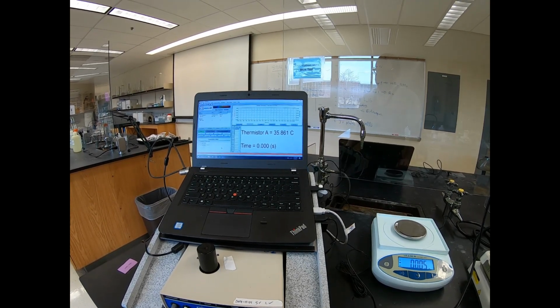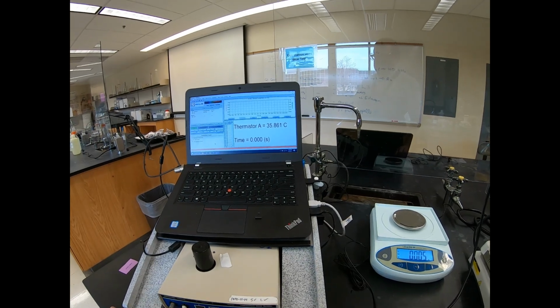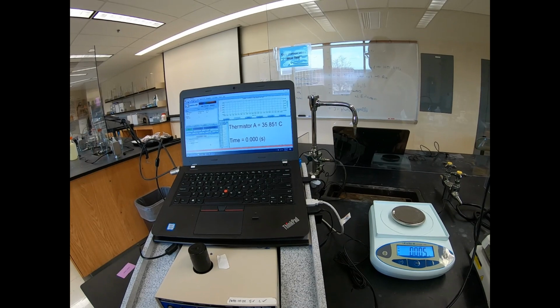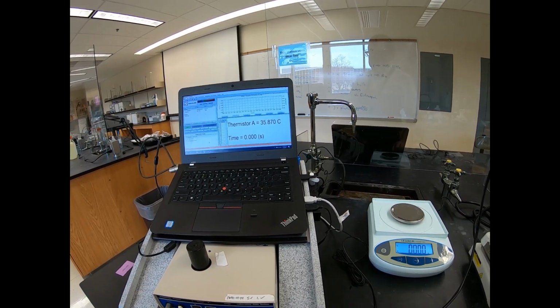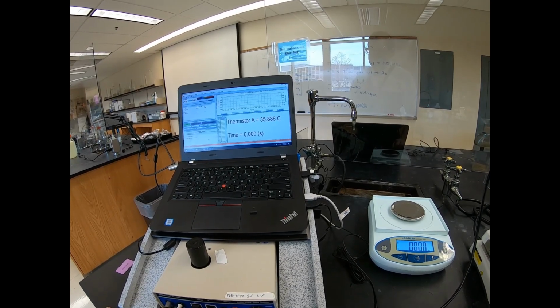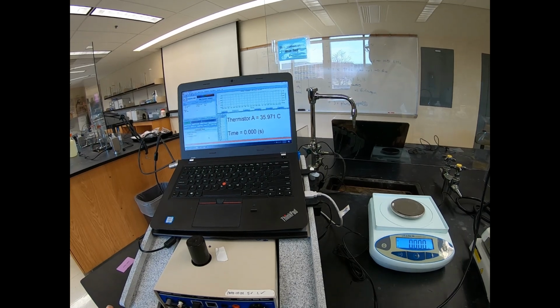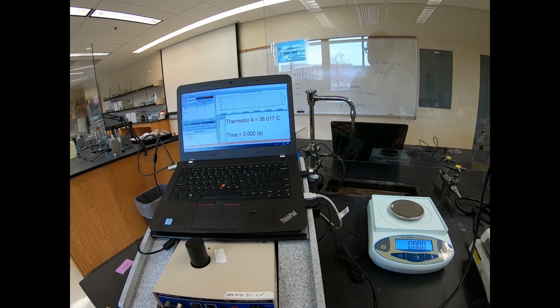And so you'll notice this is different from the lab sims, where in lab sims it reached its peak temperature almost immediately and then started cooling down, whereas in real life it takes a little bit of time to get all the reaction to fully react, and then the temperature will slowly start to come back down. But it is not an instantaneous thing, because apparently a little bit more reaction has started because it's kind of creeping back up again.